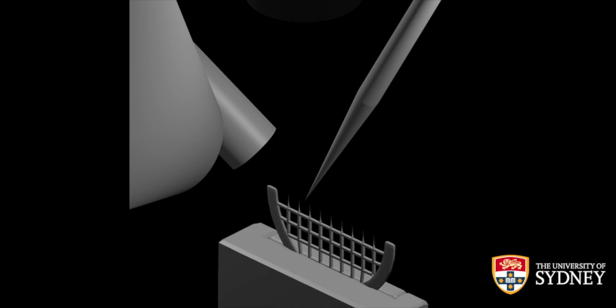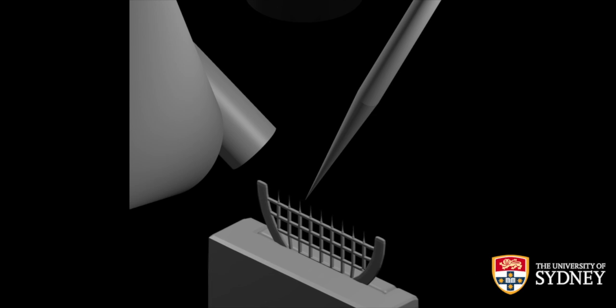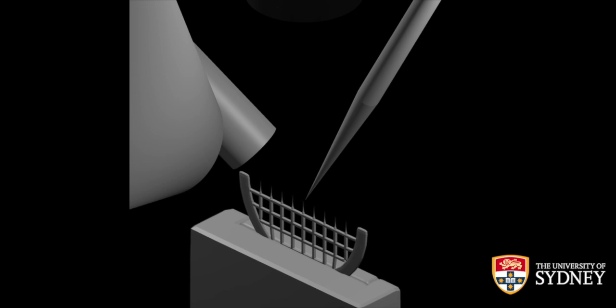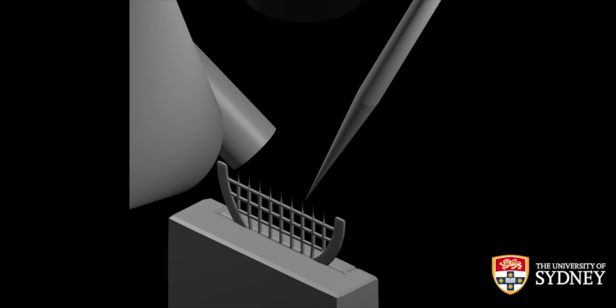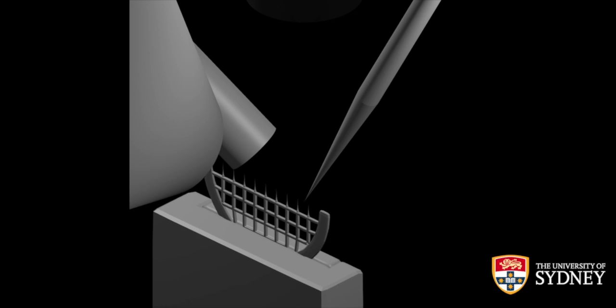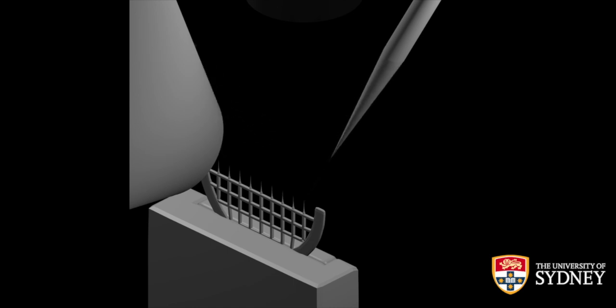Well, from there on, it's step and repeat, really. So you do the steps with the approaching, attaching, welding, cutting off, for however many samples you want to make. Usually on a grid with 9 pins, which is done at 100 mesh, I would make 5 samples. I would skip every other pin simply because if they're too close together, one tip flashing in the atom probe will damage the next tip. It just happens. I think if they're closer than 250 microns, that's what happens.